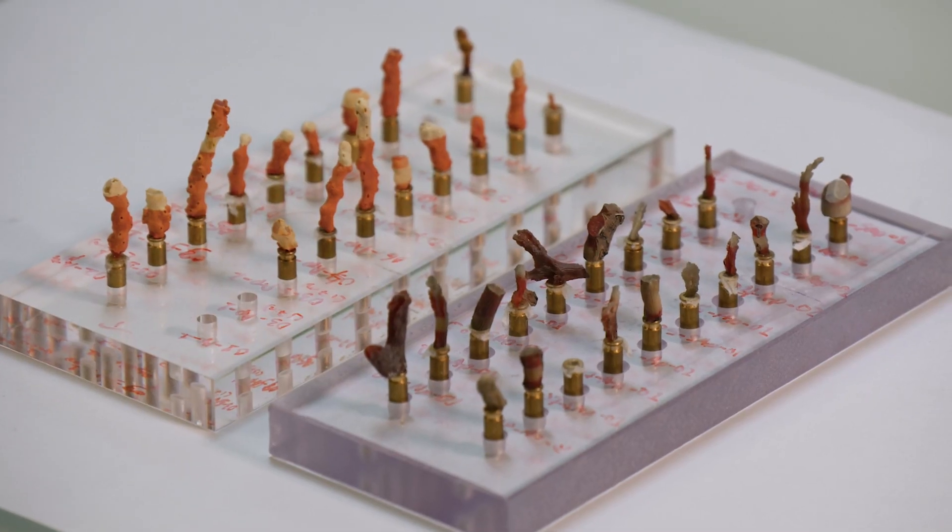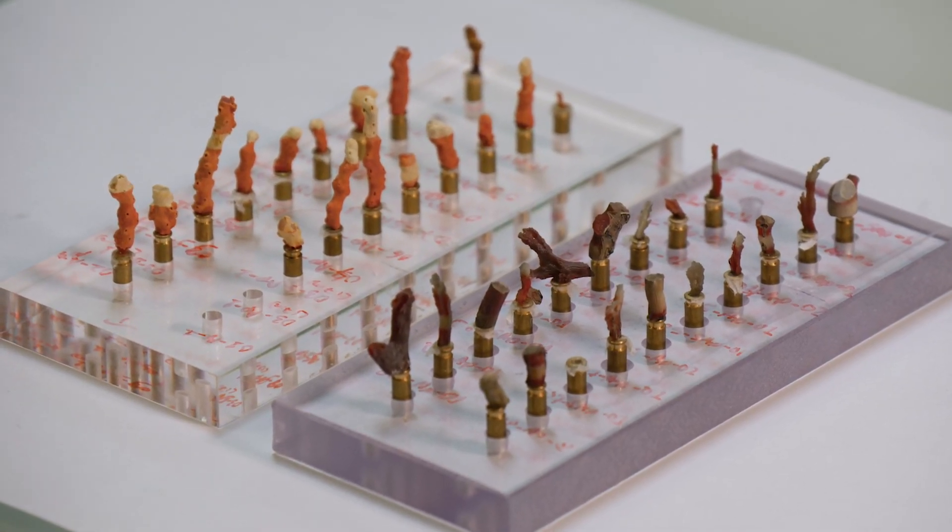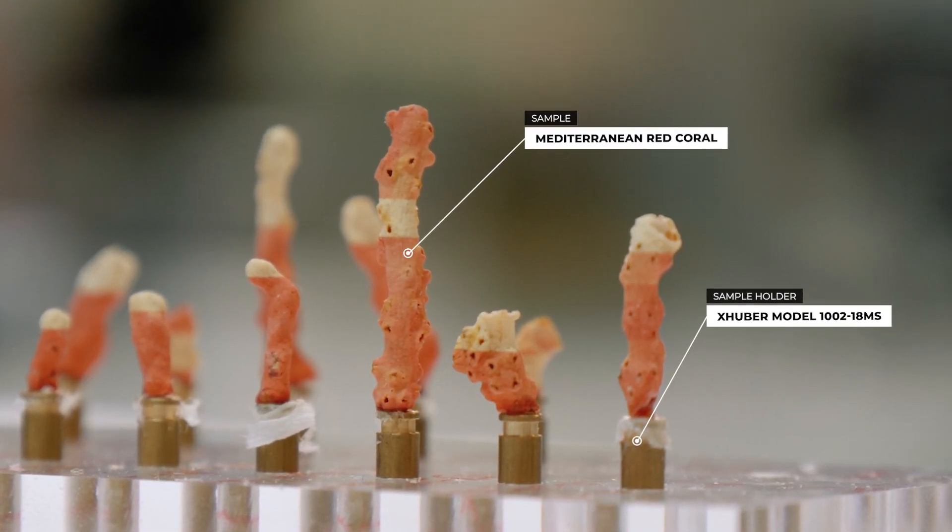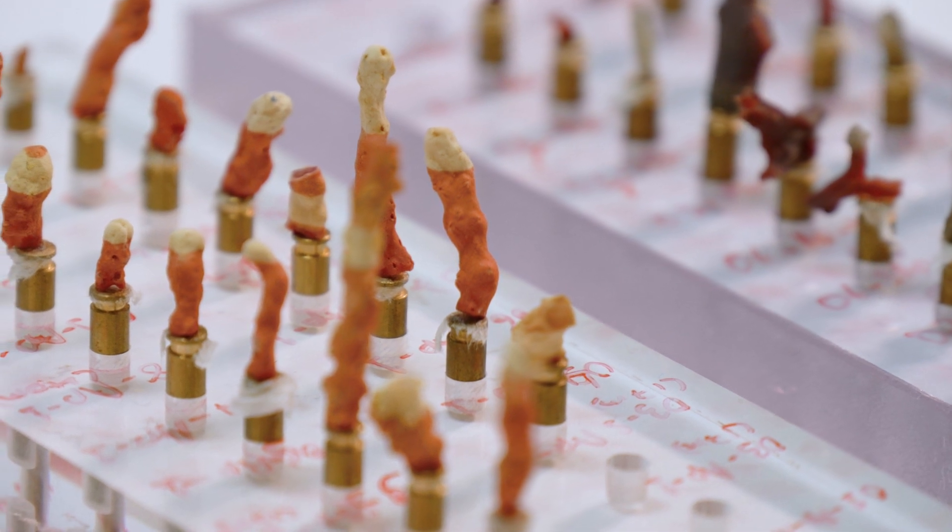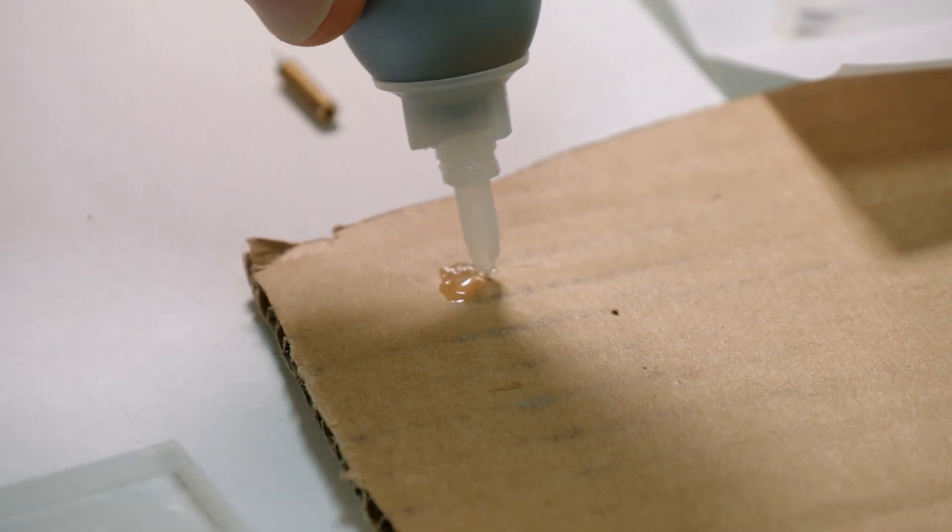If your samples are rigid and freestanding, such as the mediterranean red coral seen here, they can be glued onto a standard x-ray diffraction holder pin. We use a fast hardening glue.